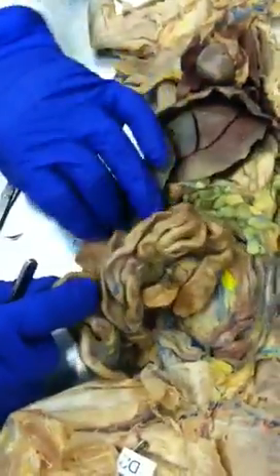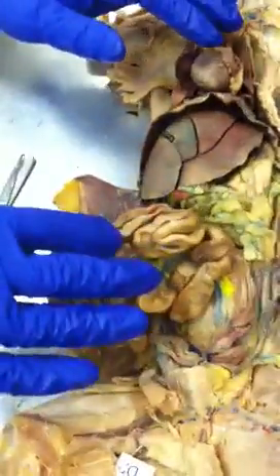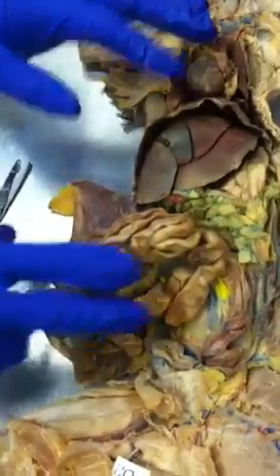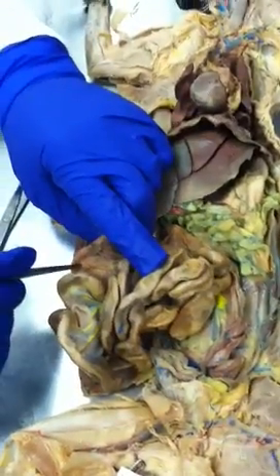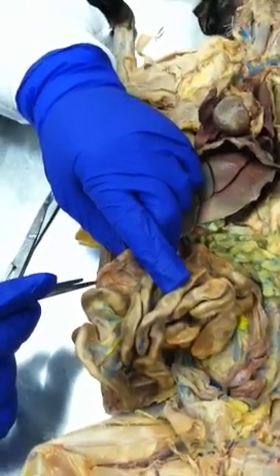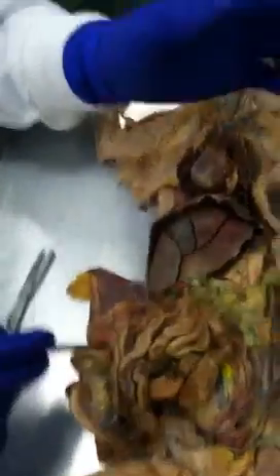All right. One of the things that happens in the exam is that people will be moving these things around, but you want to make sure you get the large intestine, the colon, oriented. If I was to put a pin over here, very close to the ileum, what part of the colon would that be? Ascending colon, right? You see that? So that's how you can tell.